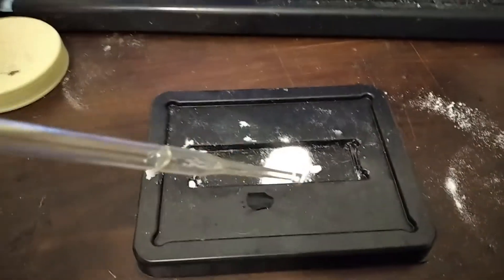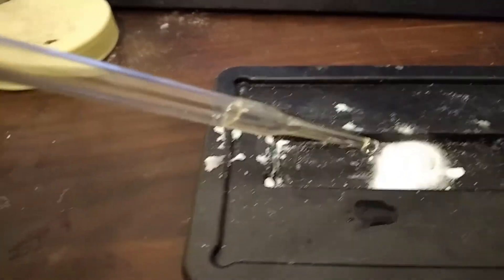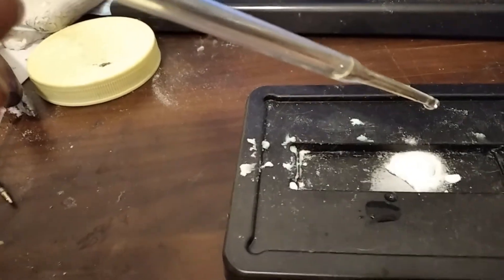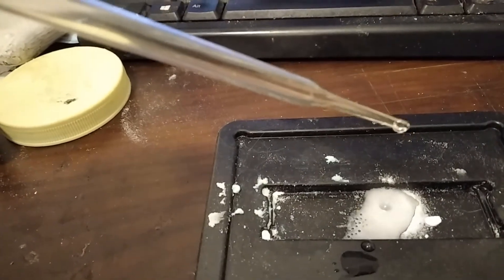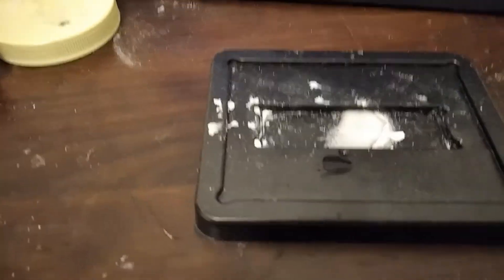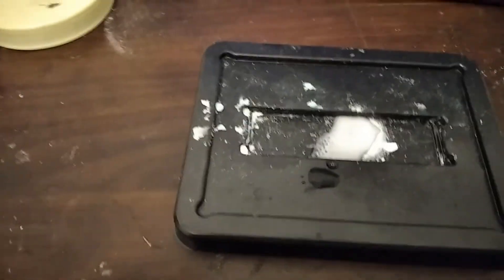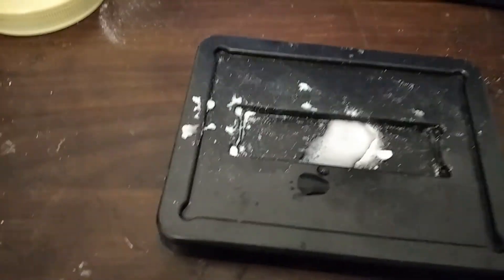I'm back here with some of the HCl from the chamber. As you can see, this stuff fizzes when I drop it onto the sodium bicarbonate, which is an indicator for it being acidic. And that's basically it — this cell produces HCl, and because it's so hard to get from where I am, it's quite good, despite the convolutedness of building, setting up, troubleshooting, and all.